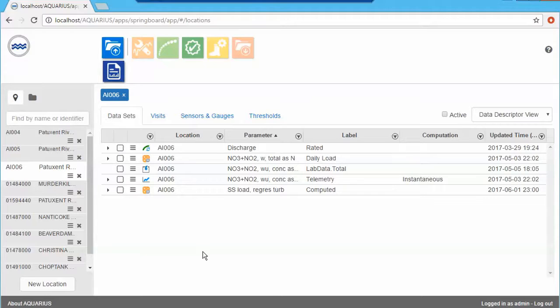Just a quick note, if you're interested in learning more about Aquarius Time Series beyond what we'll be covering today, there's an additional set of videos on our website because it's too much to cover right here. But let's just get into this example right there. So I'm already looking at the location Quilty Farms at the Patuxent River right there. We can see this is a small data set of just a few time series signals and samples data, by the way, that we need for this example.